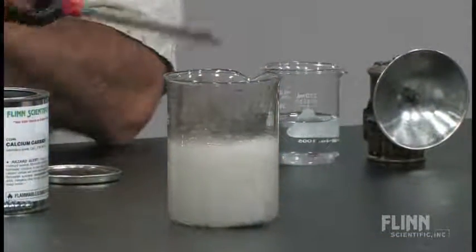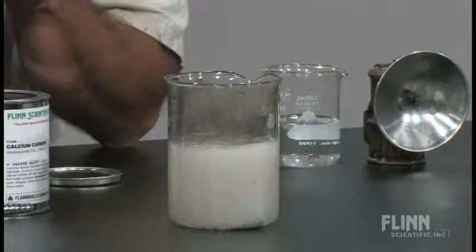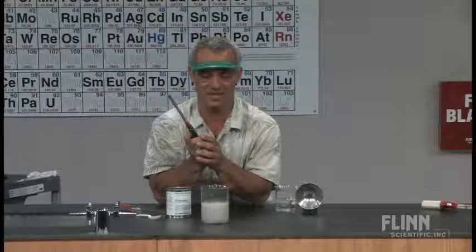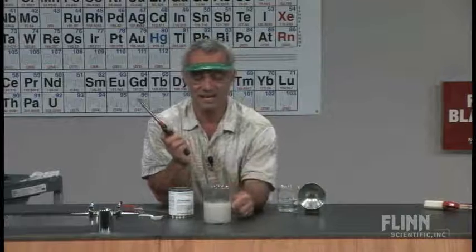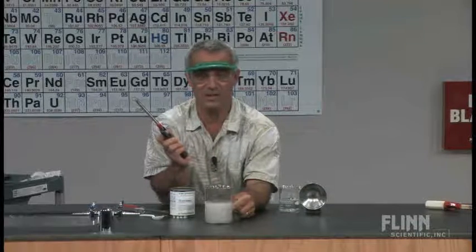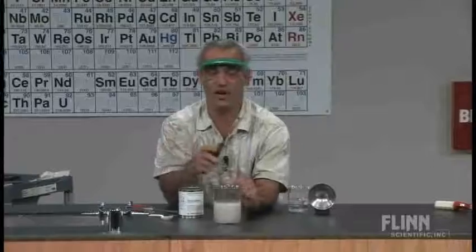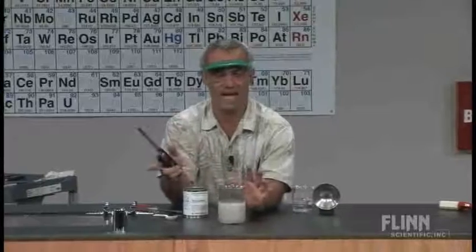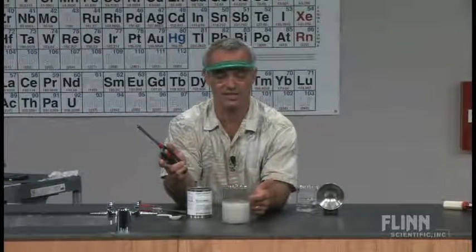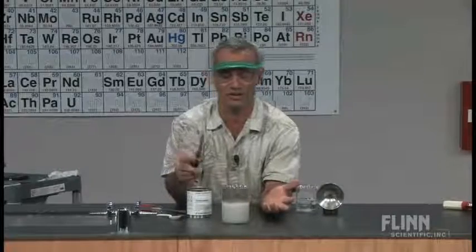Nice little flame going there. As long as we've got some acetylene going, we've got some combustion going. You also notice how it turns this milky white. I love this because both the reactants — the calcium carbide and the water — and the products — the acetylene and calcium hydroxide — are also visible.